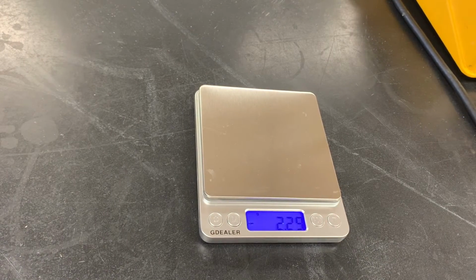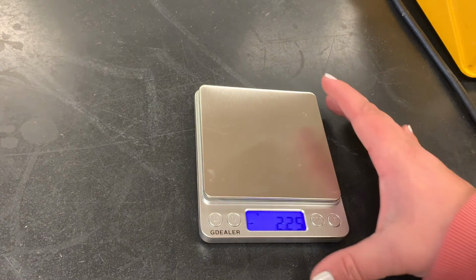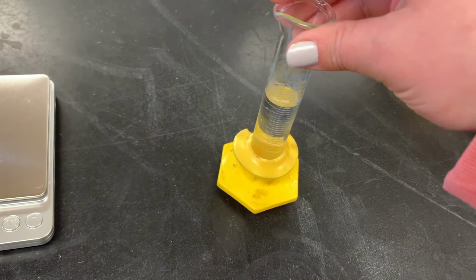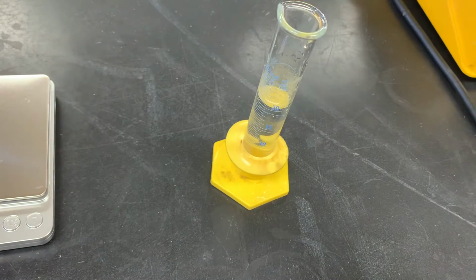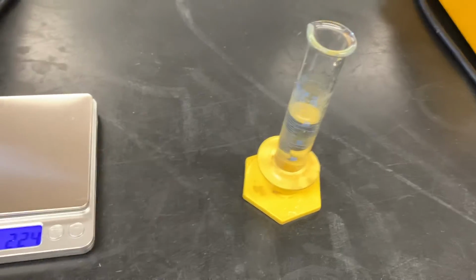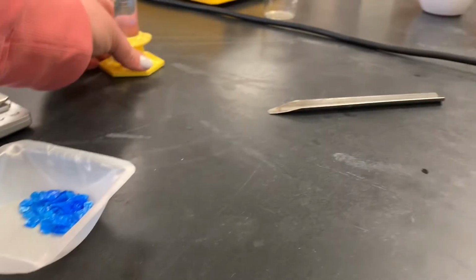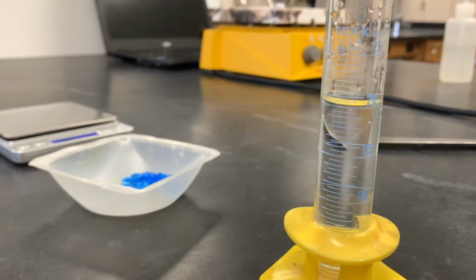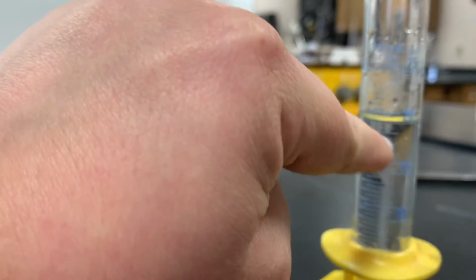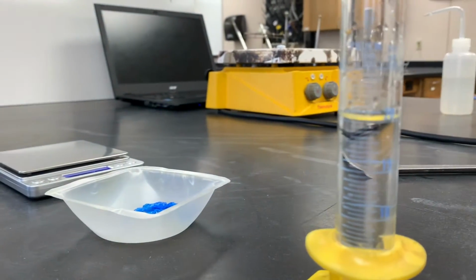The next part of our question says that I need 20 milliliters of water. Okay. So when we measure water, we use something called a graduated cylinder. And I've done a little legwork ahead of time and I've already set up 20 milliliters in this graduated cylinder. What I'm going to do though is move the camera down so that you can see exactly where that measurement is. So if we were measuring liquids in a graduated cylinder as part of our lab, we would always get down to eye level. And we want to look to see, is the meniscus, that little indent in the middle of our water level, right on the line?